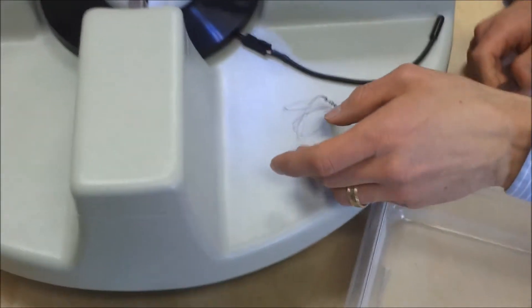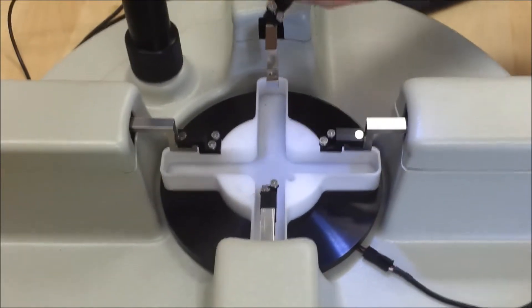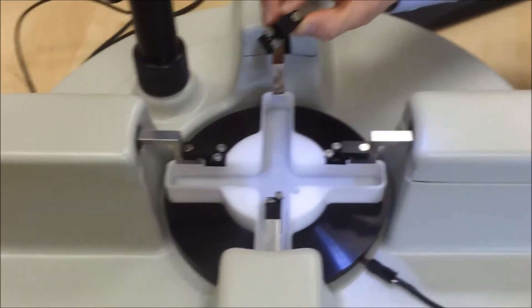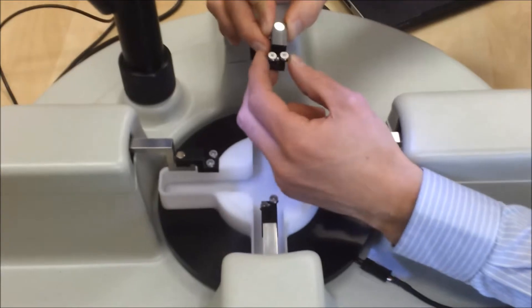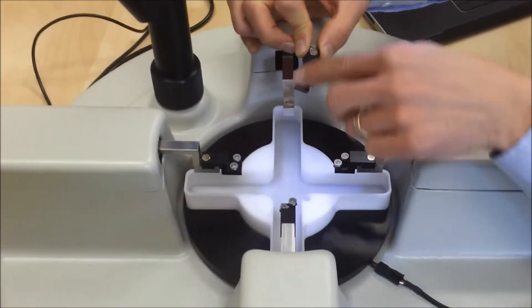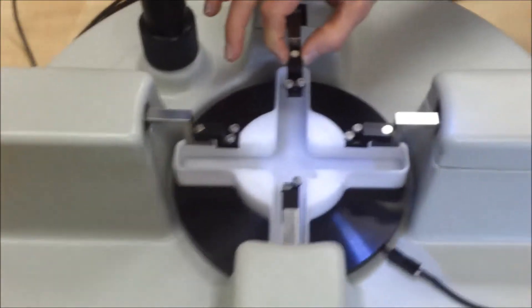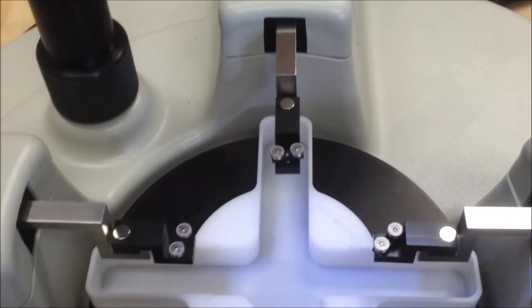On the biotester, where I would often be mounting the bio rakes, using that magnetic mount also available with the biotester, are these suture brackets. And what they have is a central pivot, and around that central pivot, there's two pivoting pulleys. And if I hook my suture loops over those pulleys, I can achieve a force balance on those four suture lines during the test.